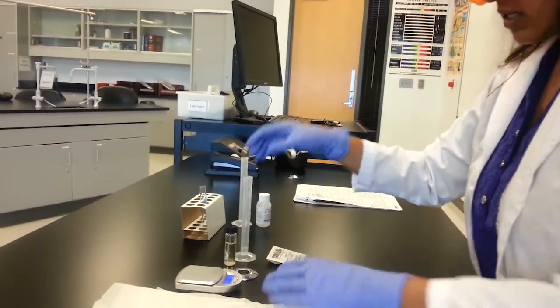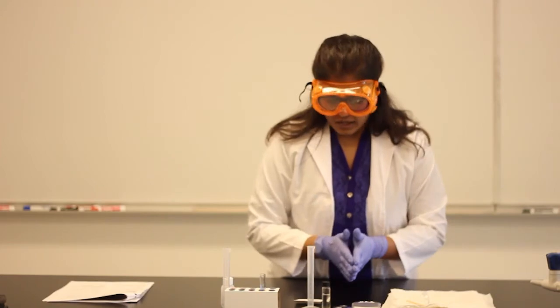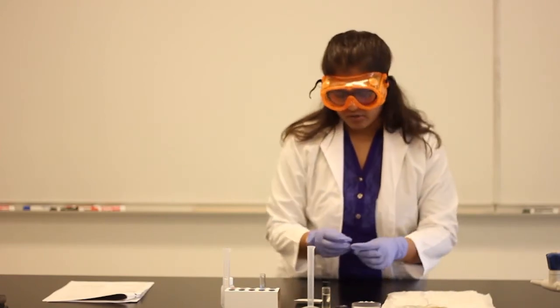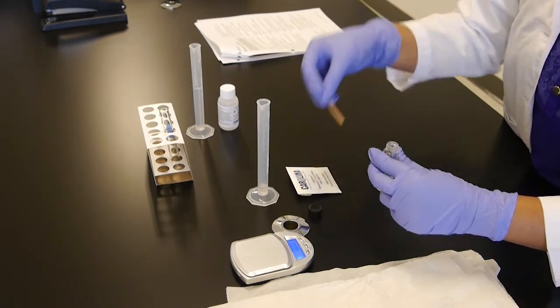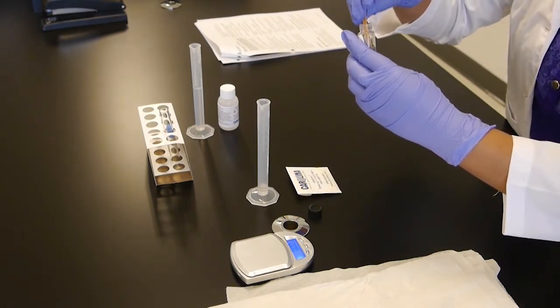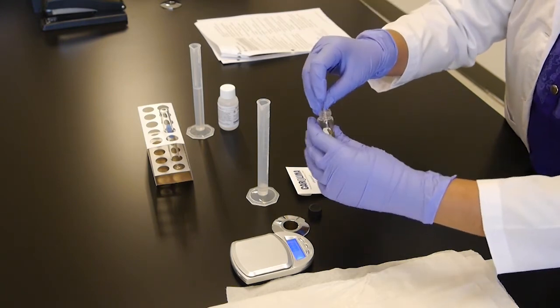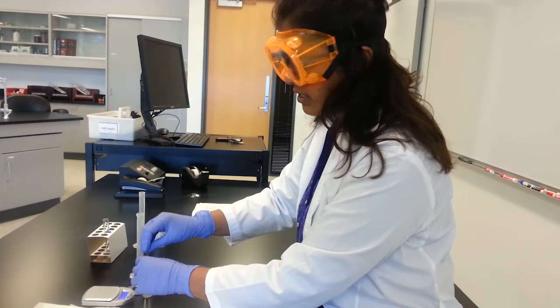From the weighing balance, you can see the mass. So from there you can easily calculate the density. What was density again? Mass by volume. Now let's see the pH of this biodiesel. So simply take a strip of pH from the packet, see if there's any color change or not, and make sure to write down your observation on the data table.